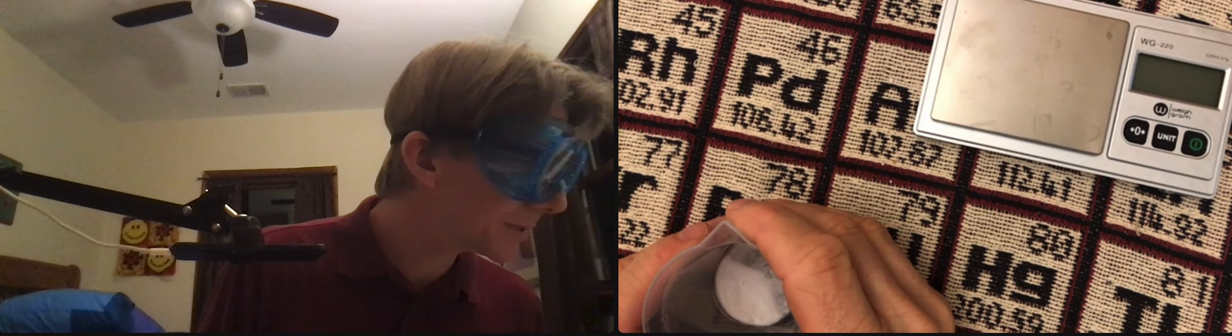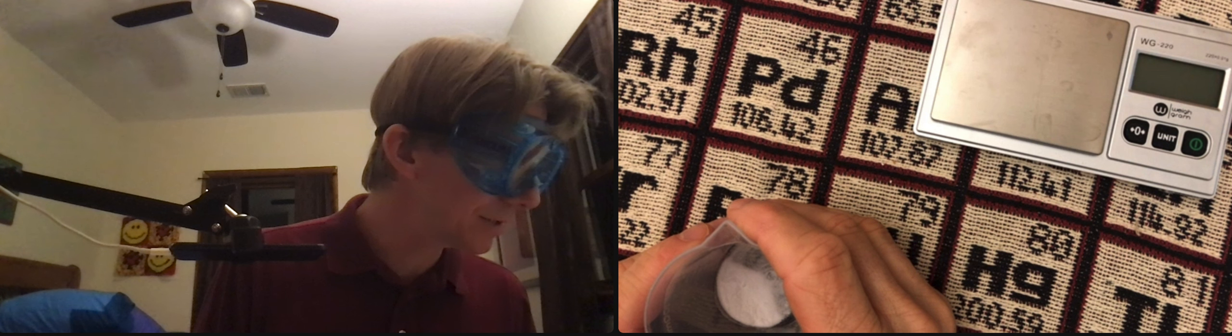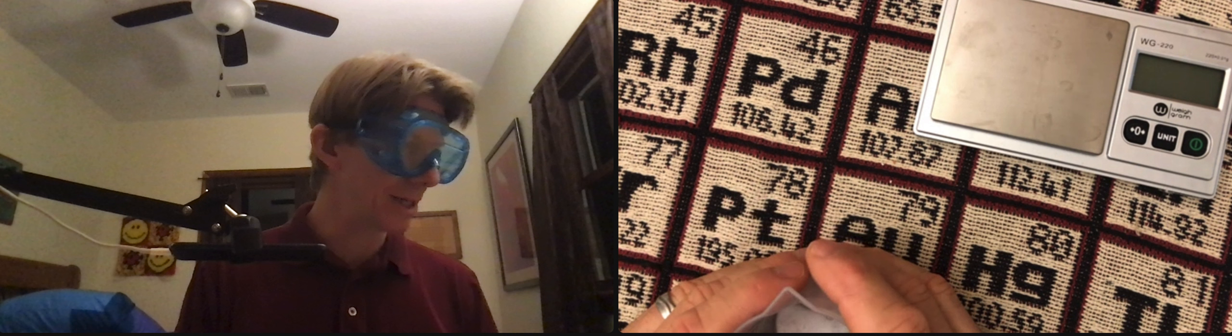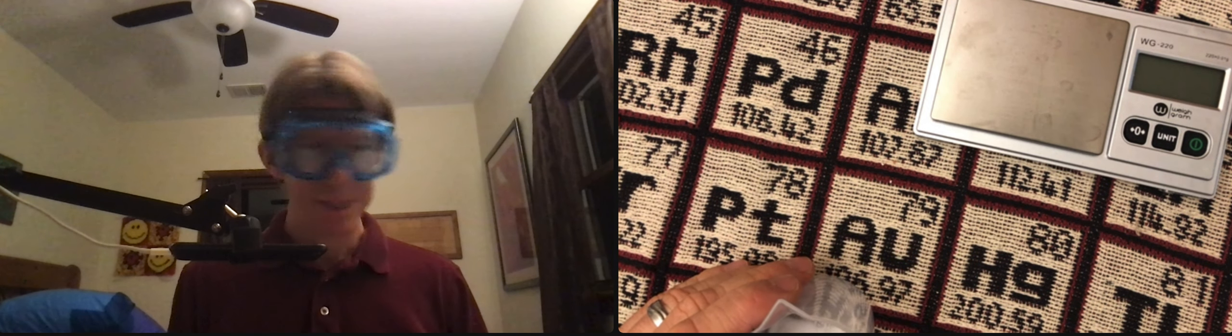And record the mass of the beaker. Good. Use a clean plastic spoon. I cleaned it to stir the sodium bicarbonate solution for approximately five minutes and I need to add water.